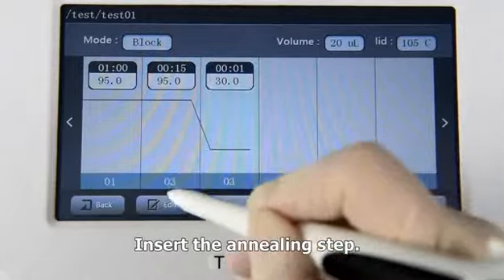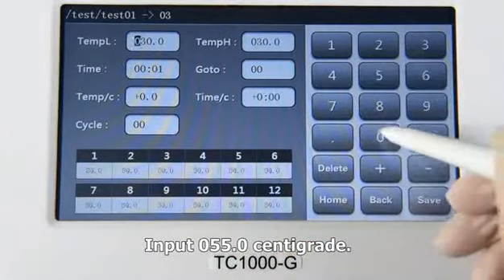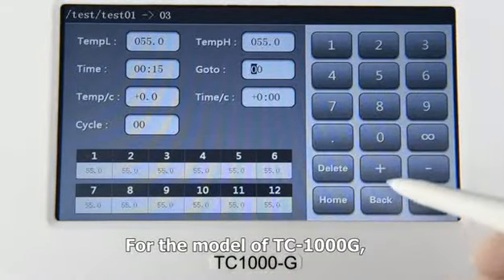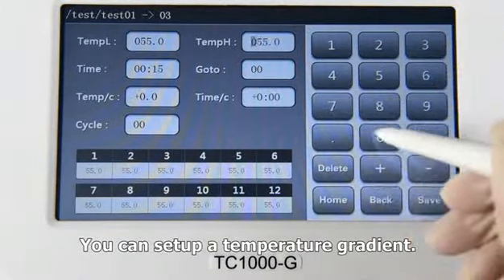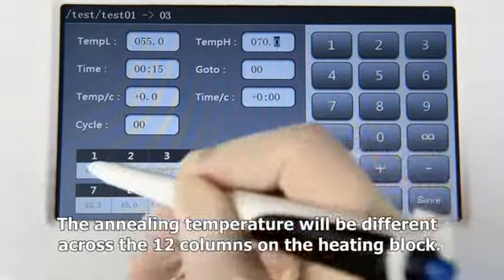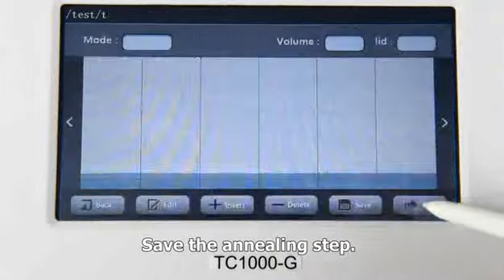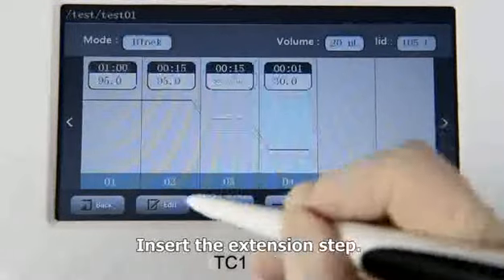Insert the annealing step. Input 55 centigrade. Input 15 seconds. For TC1000-G, you can set up a temperature gradient. The annealing temperature will be different across the 12 columns on the heating block. Save the annealing step. Insert the extension step.